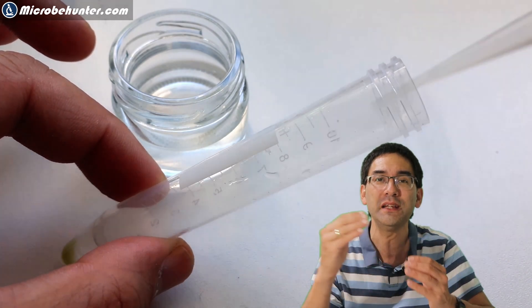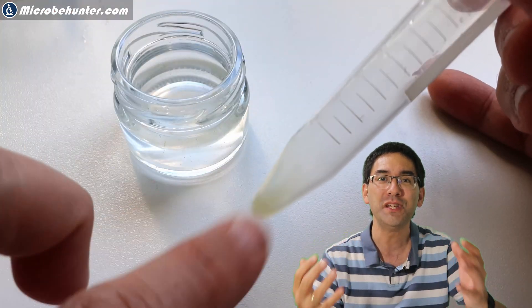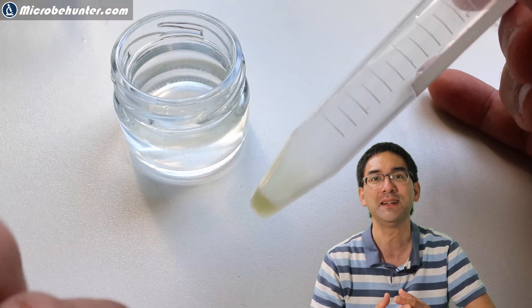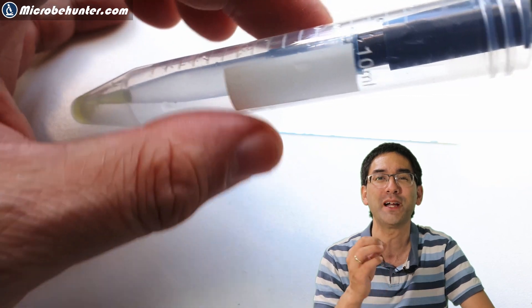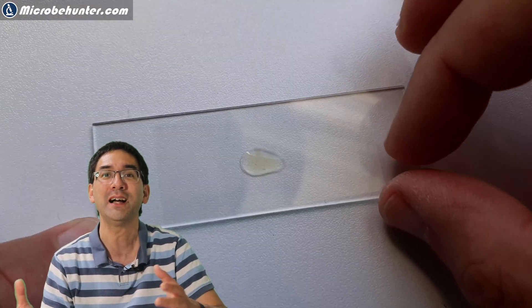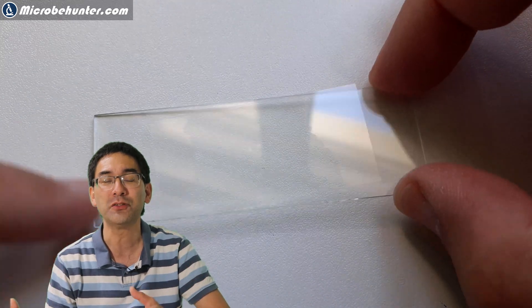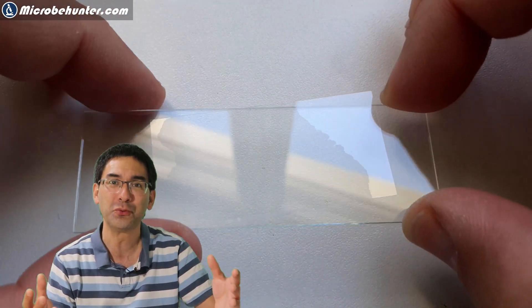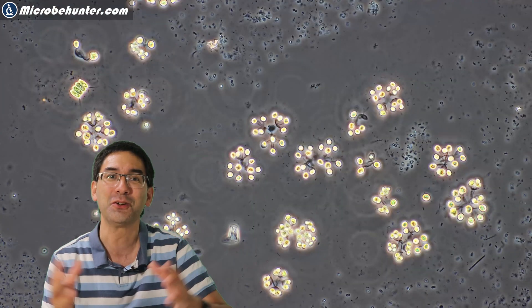I removed the supernatant — the clear liquid on top — and resuspended the cells in a small drop of water, then transferred a small amount onto a microscope slide. Luckily I was able to find both bacteria and also green algae: eukaryotes and prokaryotes, the two important cell types, and here they are.